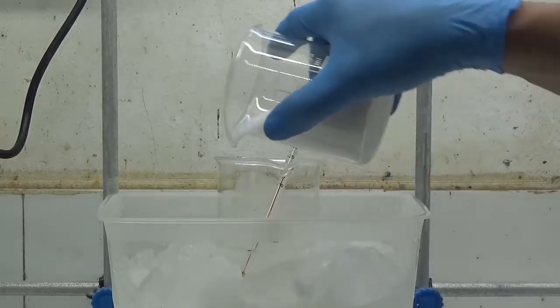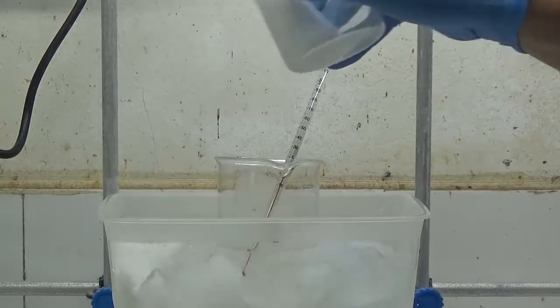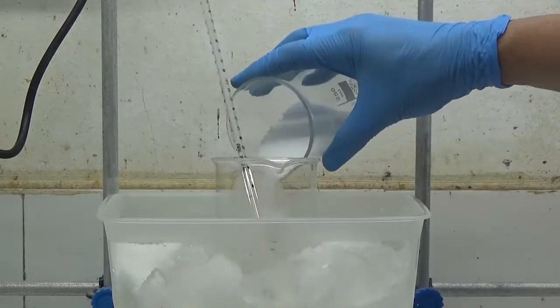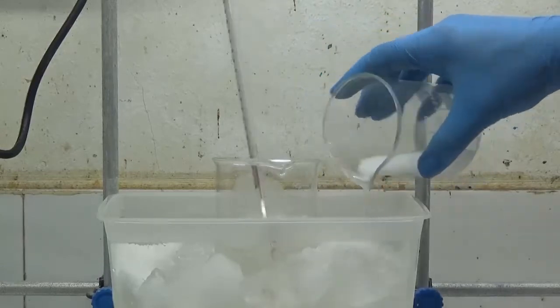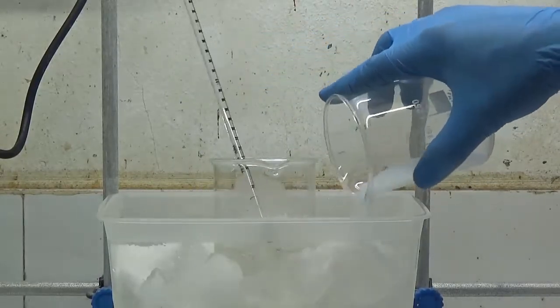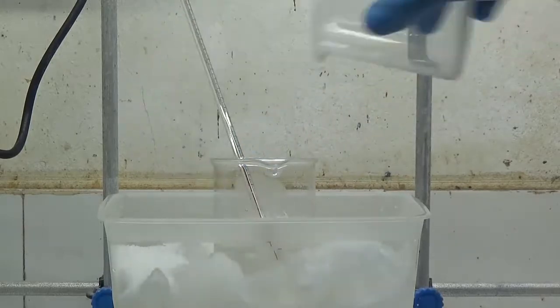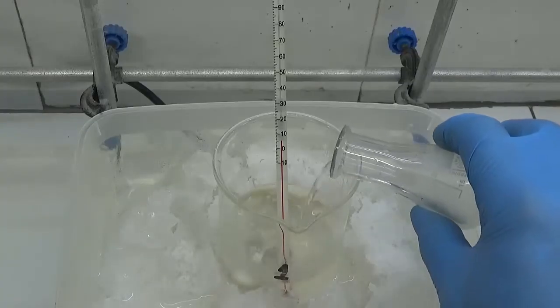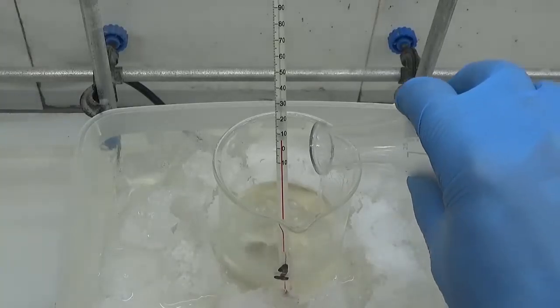Diazotization: Cool with an ice salt bath solution 1. Add sodium nitrite solution 2.